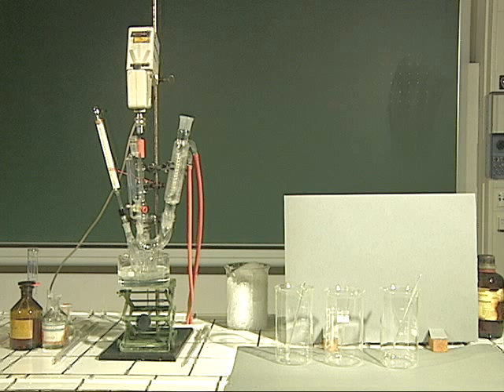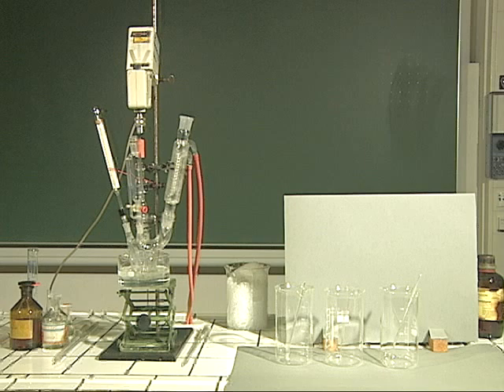The setup consists of a reaction flask equipped with a stirrer, reflux condenser, dropping funnel, and a thermometer.